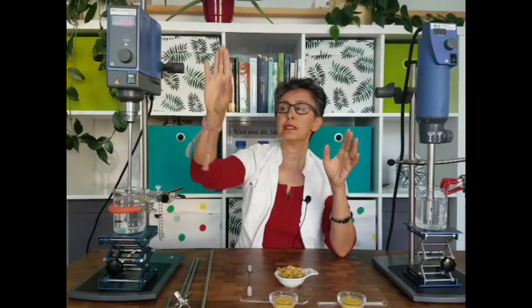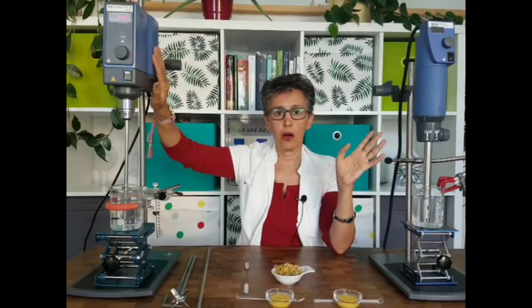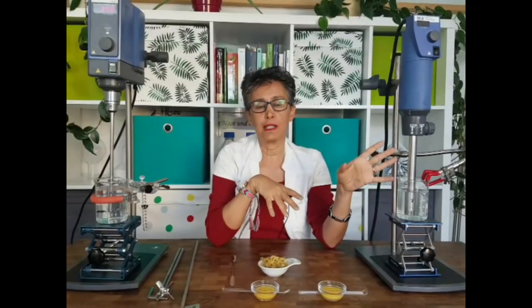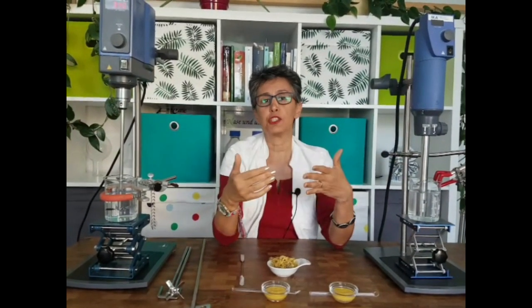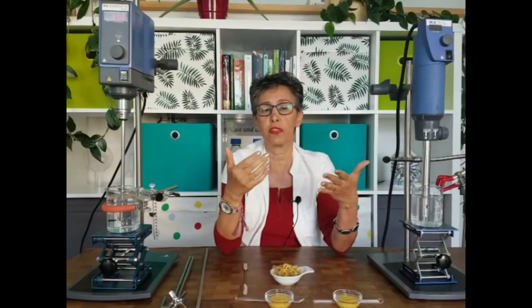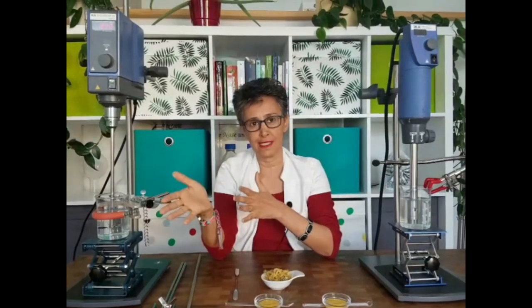You can turn the overhead stirrer on and it can go on for hours and hours — it works continuously. The homogenizer is used only for a few minutes per batch; you practically turn it on for 2-3 minutes per batch and then move on to the next step.